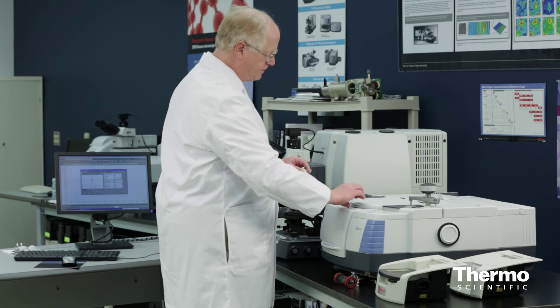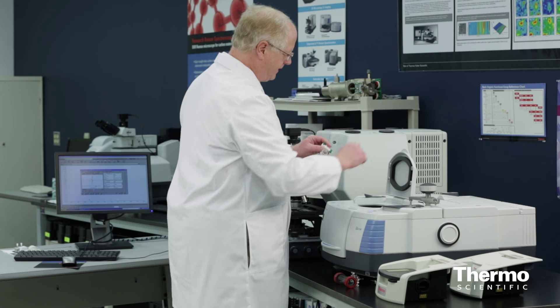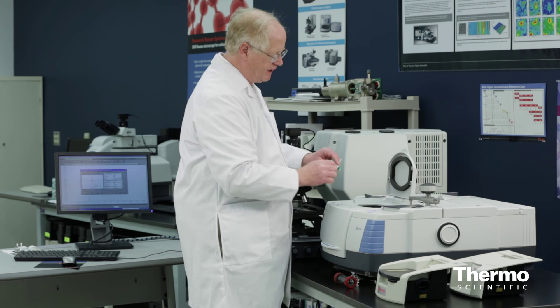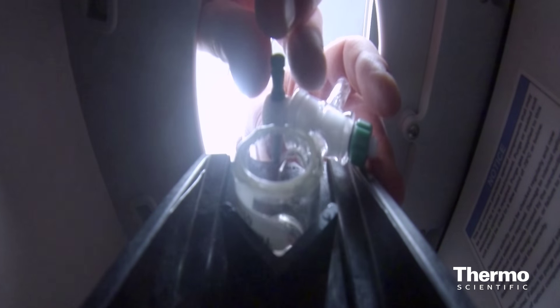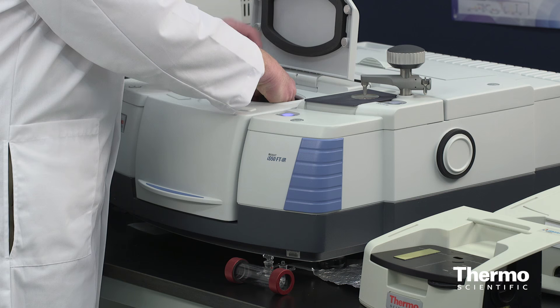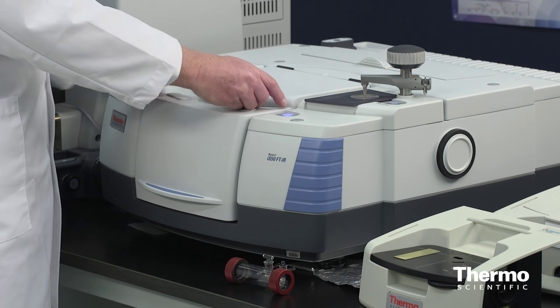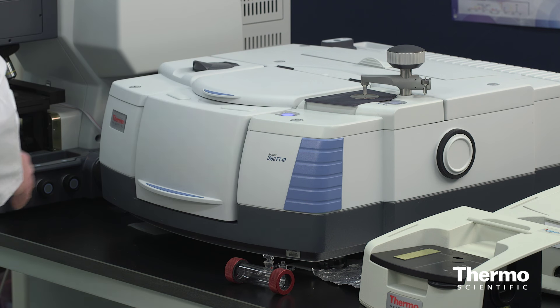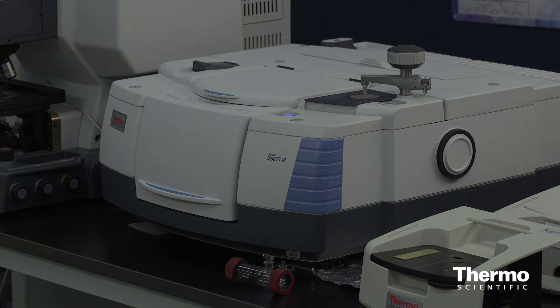To insert it into the spectrometer, all I have to do is lift this cover. There's a V-groove in there that I'm just going to lay it down into — it slides right into place. Then I close the cover and now I'll move over to the computer and show you how we go about collecting the data.